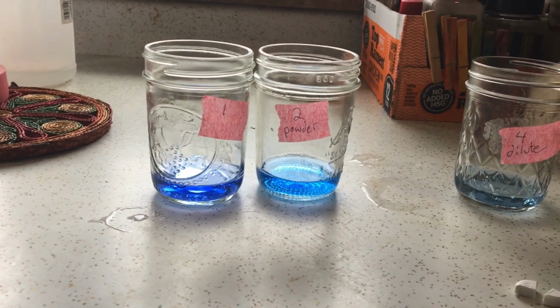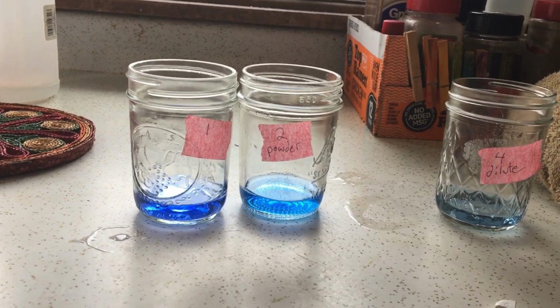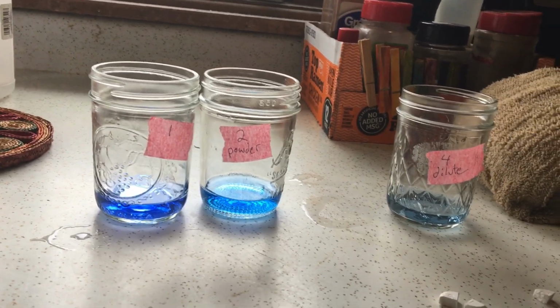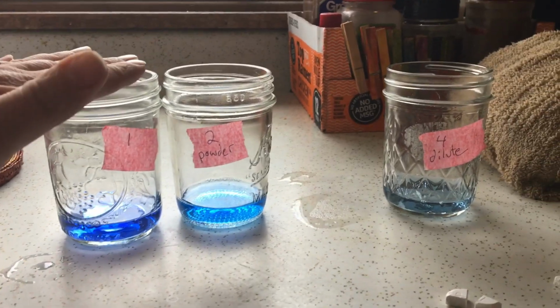You should read the experiment. I'm not going to go through it step by step, but you can certainly observe what I am doing here at home. And certainly, if you got the stuff, go ahead and do it at home. It might be fun just to check it out yourself. I have labeled my test tubes.